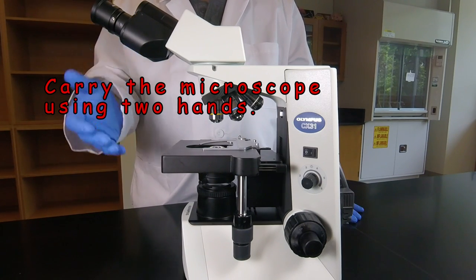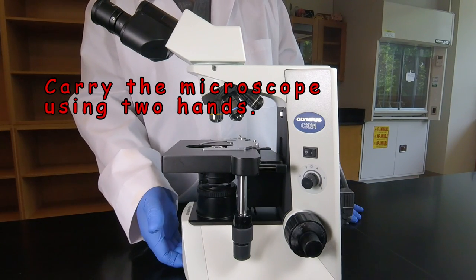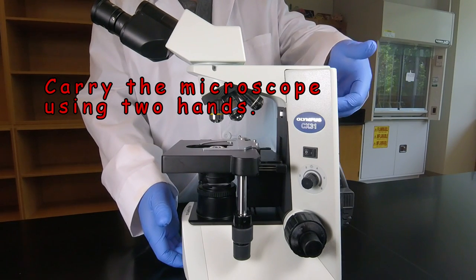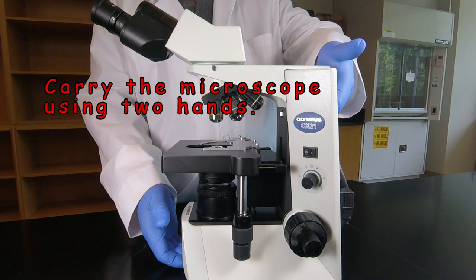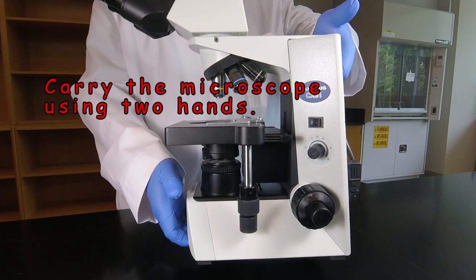And so what we do is we take our dominant hand, we put it under the front, and there's a little indentation there you can put your fingers in. Then we take the other hand and put it behind the microscope where there's another grab hold. And then we can lift the microscope and carry it with two hands, like that.